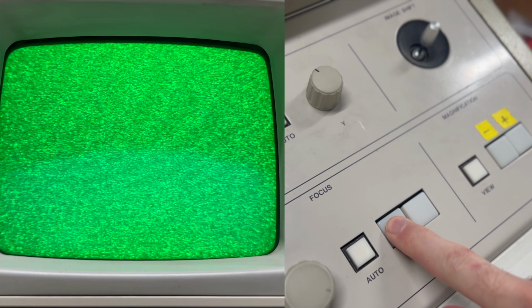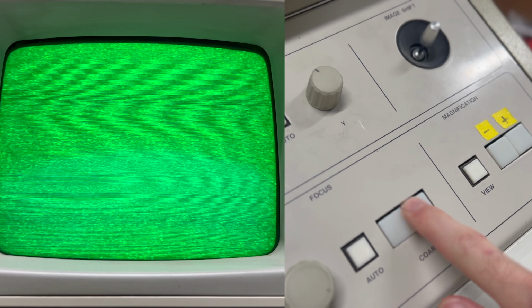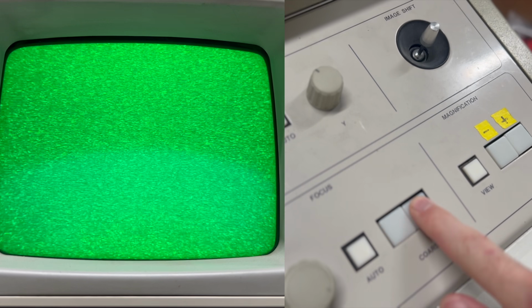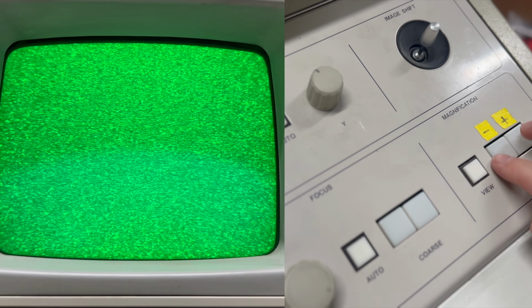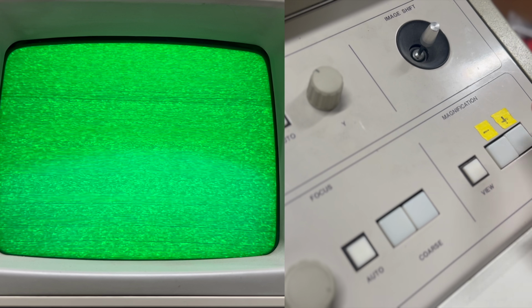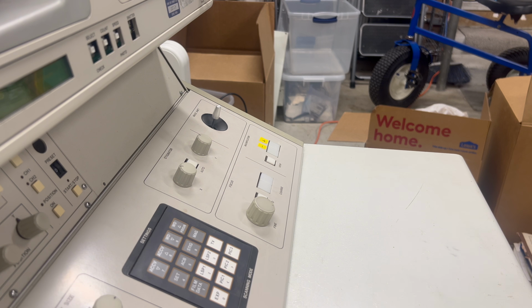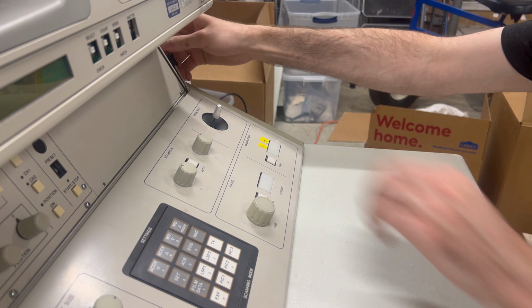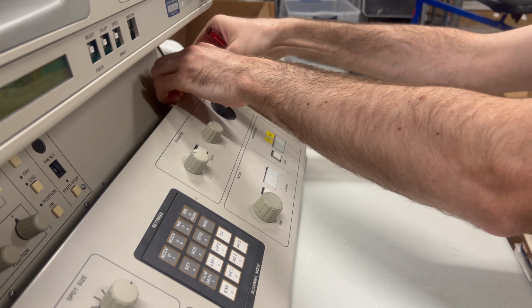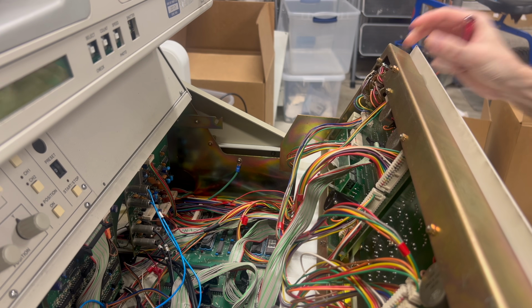The focus buttons don't seem to be doing anything. This might indicate some issue with the circuitry that drives the electron lenses. How about the magnification buttons? These also don't seem to be doing anything. Hang on a sec. Oh wow, the buttons clearly aren't working. I connected my ohm meter to the terminals and pressing the buttons does nothing. Maybe the contacts got corroded. Let's remove them and see if they can be repaired or replaced.